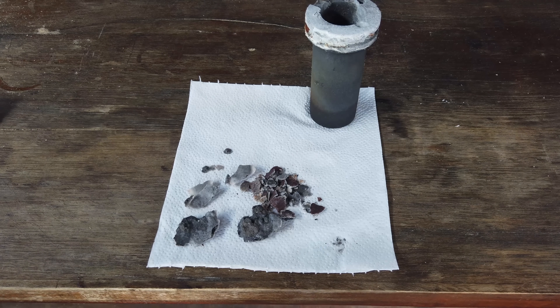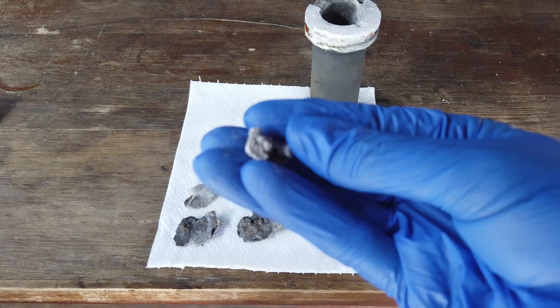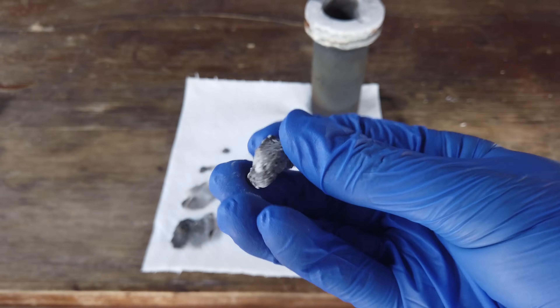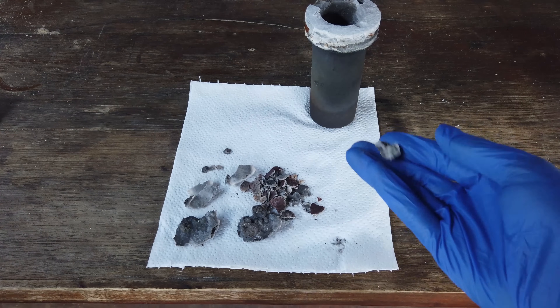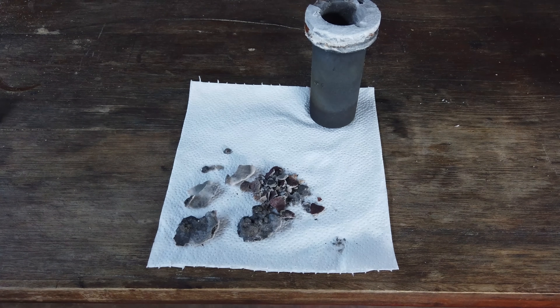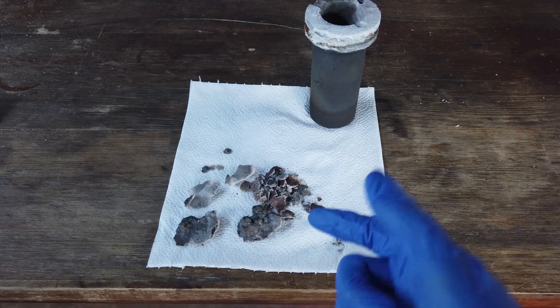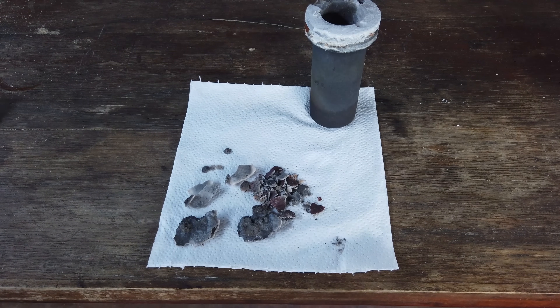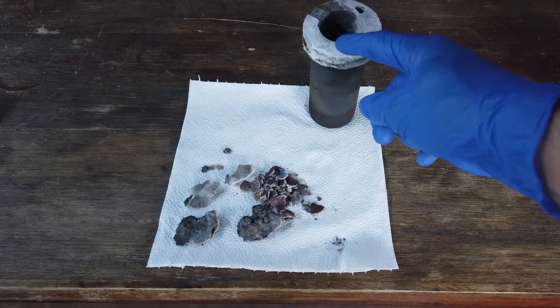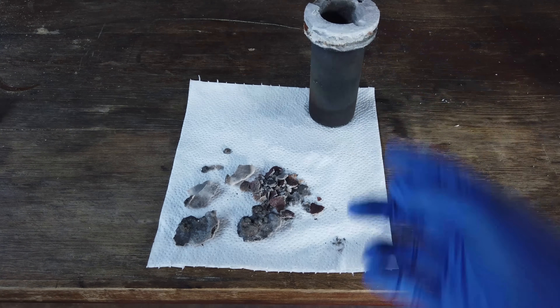It is rather disappointing that most of our magnesium product is in the form of this weird spongy stuff, because as we noted before it is extremely reactive. The stuff that I extracted from the cell initially has really turned kind of white — it looks like a bunch of magnesium oxide has formed due to the high surface area of the magnesium in this form. I think we were running the electrolysis kind of incorrectly. I should have been running everything at a high temperature to make sure the magnesium was forming in the molten state, and I really wasn't expecting the magnesium metal to be more dense than the molten salt. Normally when we make these metals they float on top of the molten mass, but in this case the magnesium was sinking to the bottom. So maybe we should have had something underneath the cathode to catch the magnesium as it was forming, or maybe we just should have used the crucible itself as the cathode to begin with.